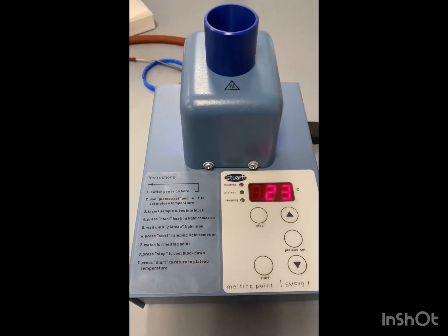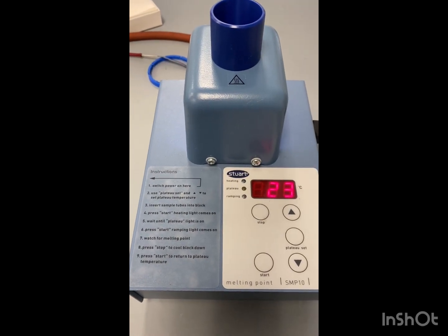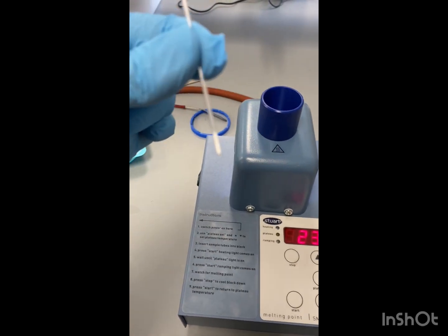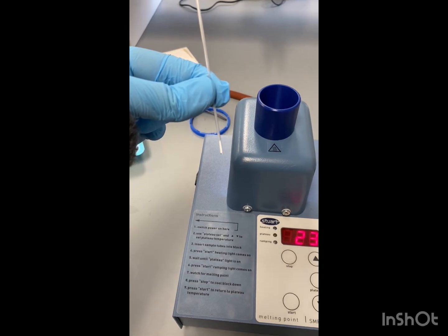All right, so we have our melting point apparatus set up here. As you can see, we have our product in our melting point capillary.